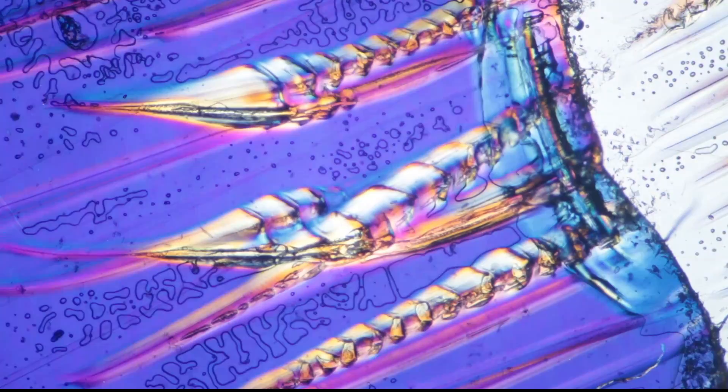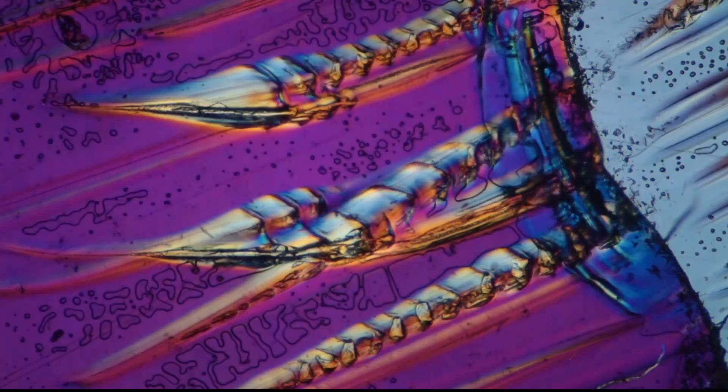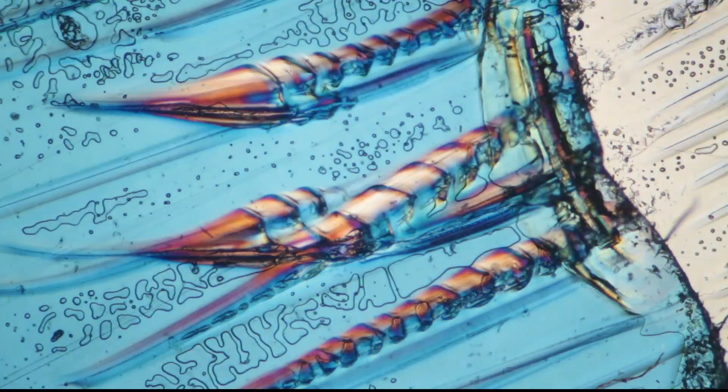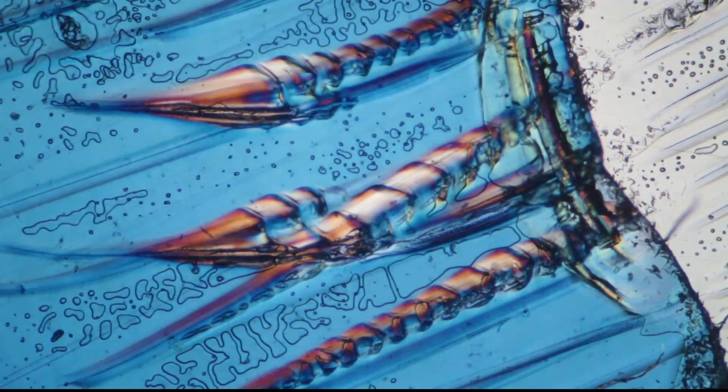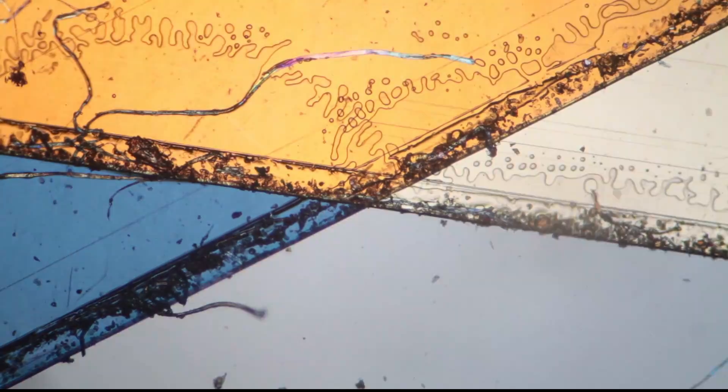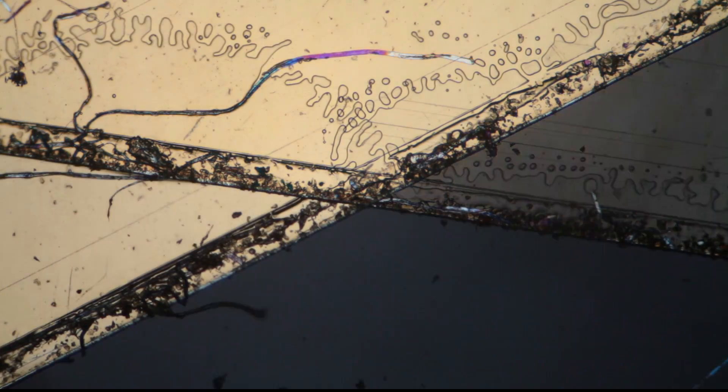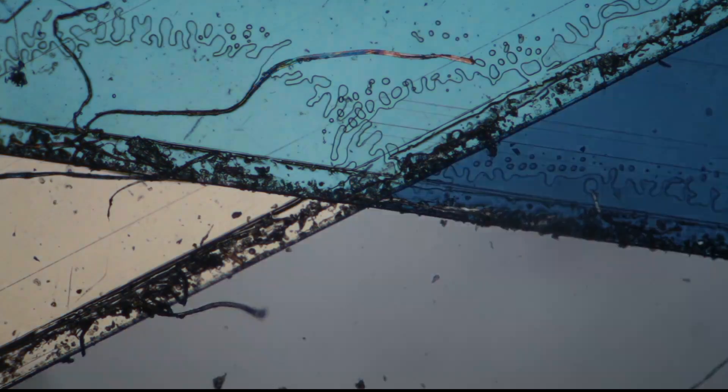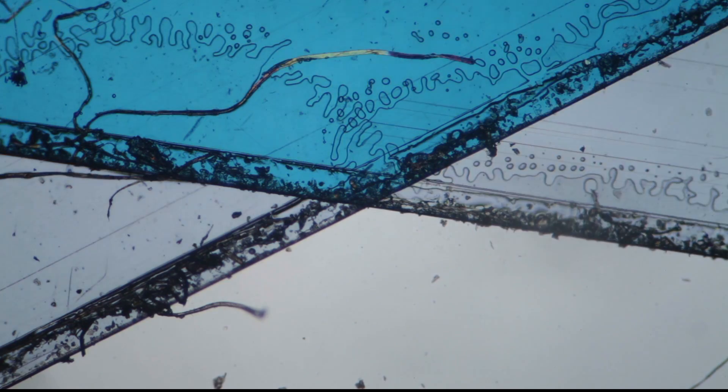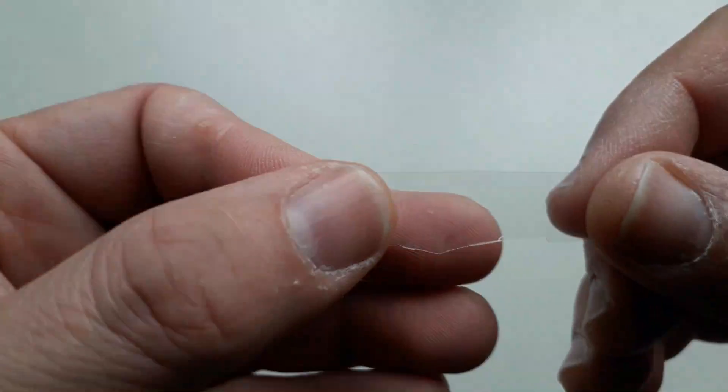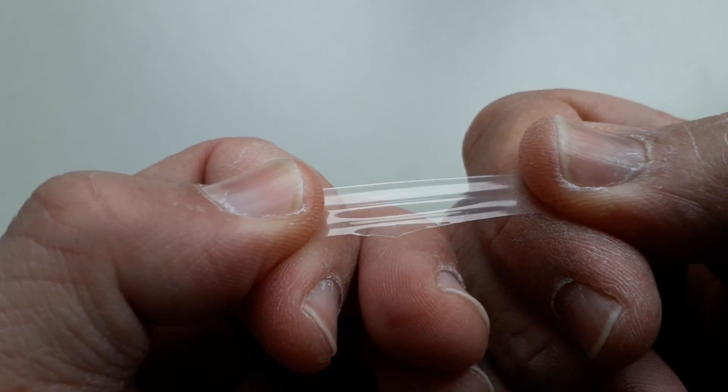Yeah okay, now let's go back to my other microscope again. Here we have again a few scratches. What you can do now is the following.